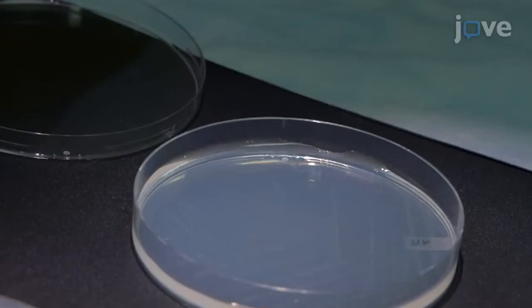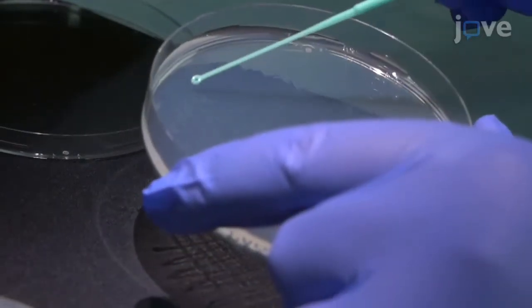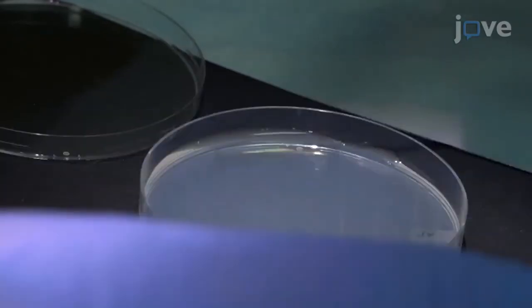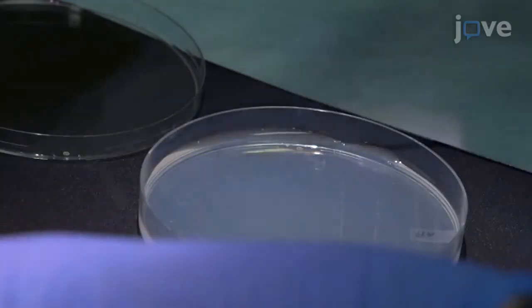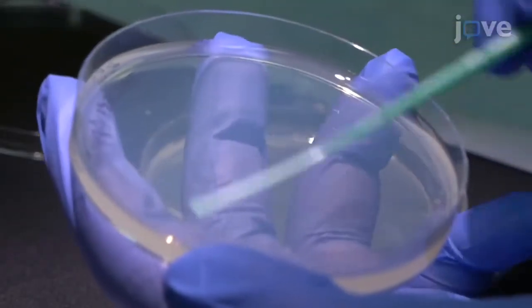On the growth plate, identify a single colony isolate that has the SCV phenotype, characterized by a colony size of 1 to 3 mm as opposed to the normal 3 to 5 mm colony size. Restreak the selected colonies to obtain a pure isolate of the SCV.